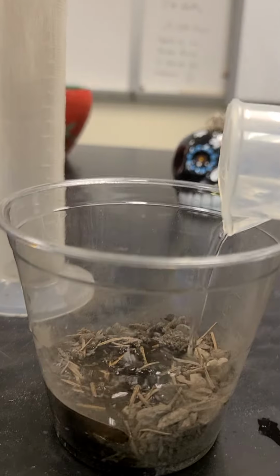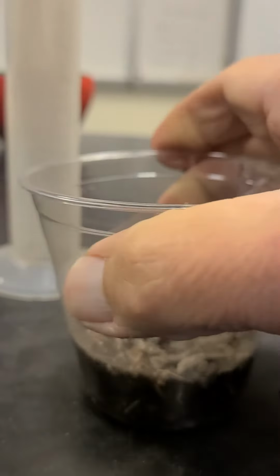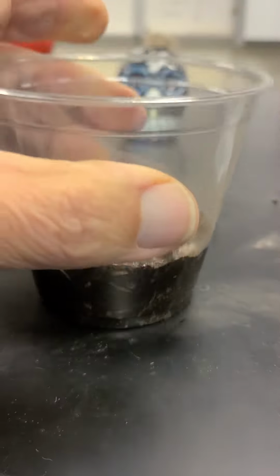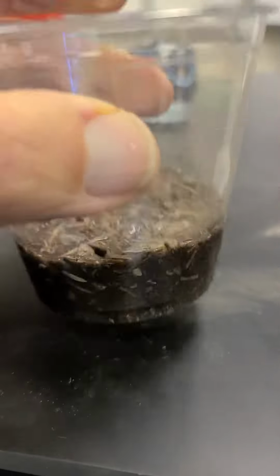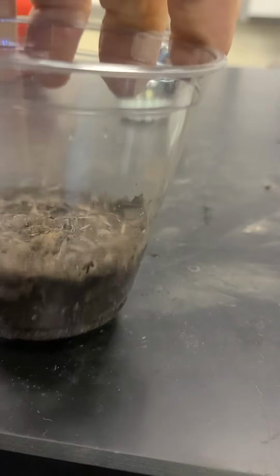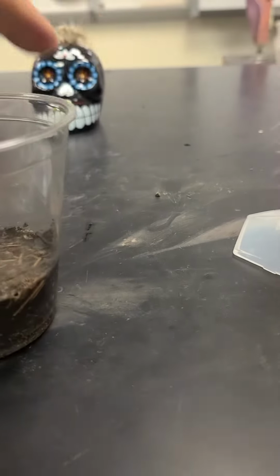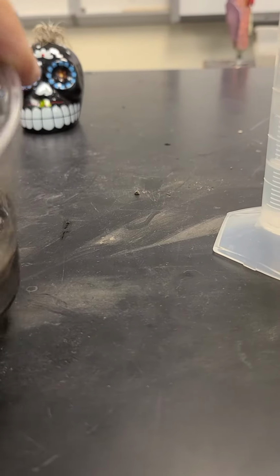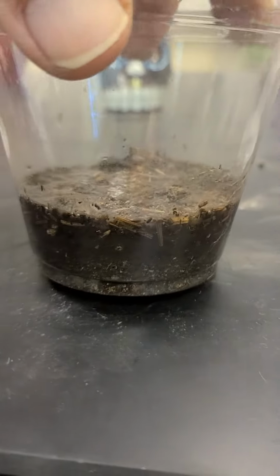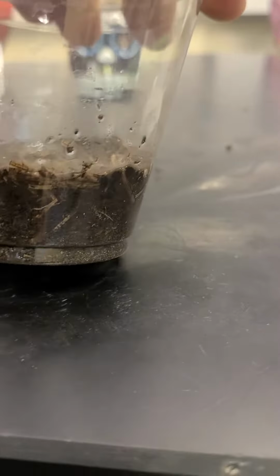and as I pour it in, I'm going to be patient with it, and we're going to let this fill up till it is completely saturated throughout. And so for this part, hopefully you move it around, make sure it gets into all the pore spaces. And I may have super saturated it a little bit, but as I move it around, that was the volume it took to completely saturate that soil.